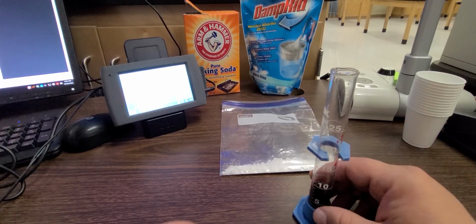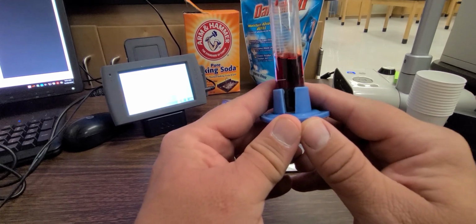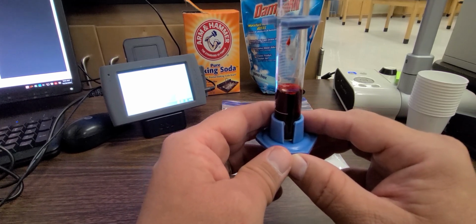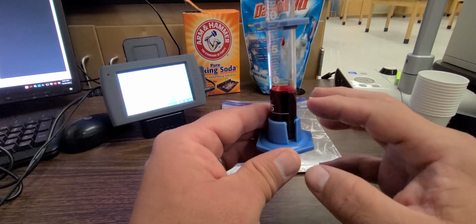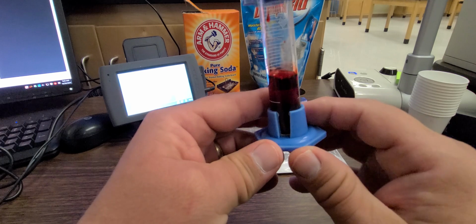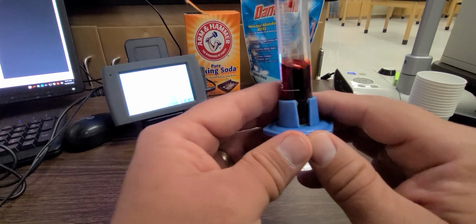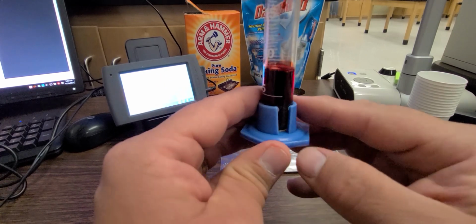Okay, so number 4 on your lab sheet is to write qualitative observations of phenol red. This is an acid-base indicator solution that we can use to pour in or to drop into certain liquids to determine whether or not they are acidic or basic. So after looking at this, on number 4 on your lab document, you need to be writing in your qualitative observations, so you're describing what you see in this graduated cylinder for phenol red.